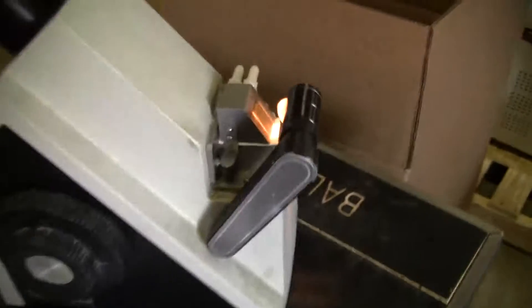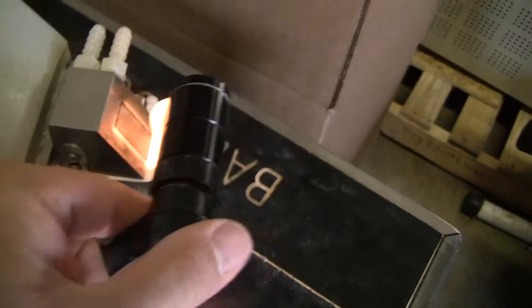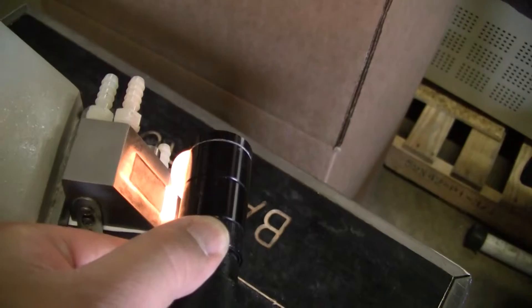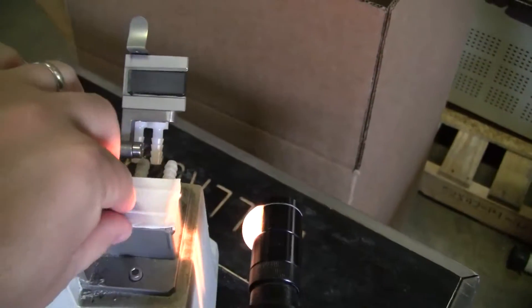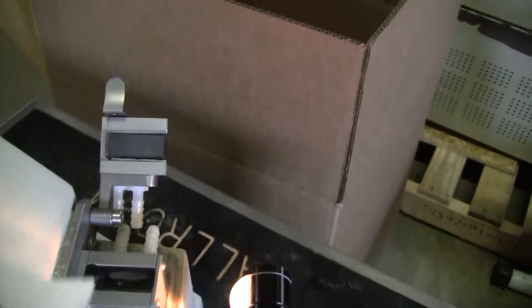We also repaired the instrument, aligning the light to line up with the prism here. Inside the cell is not cracked at all. It's very clean.